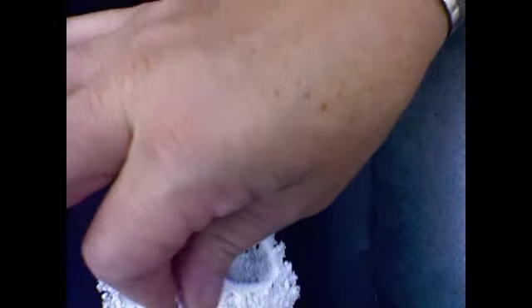Oh, very soft, very fine texture. I can't feel one particular piece of powder on my fingers, although it does tend to stick to my fingers. It's pretty fluffy, and it feels a lot like the flour that I use when I'm baking. I certainly wouldn't use this for baking, but it reminds me of the texture of flour.